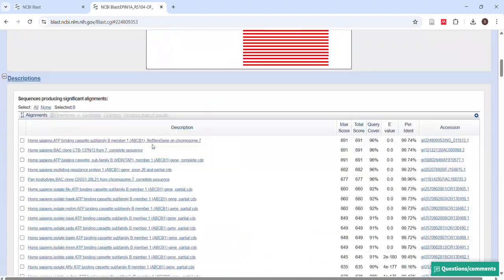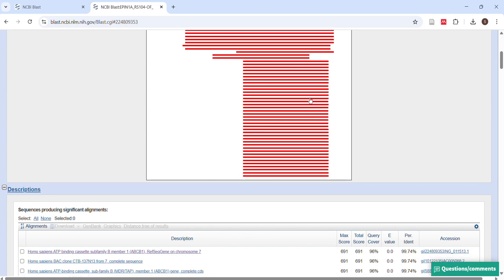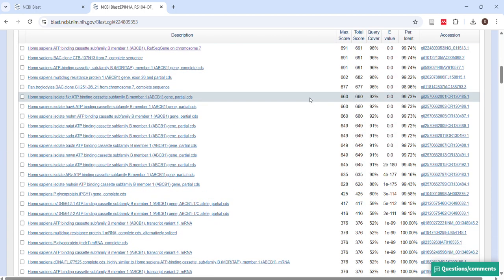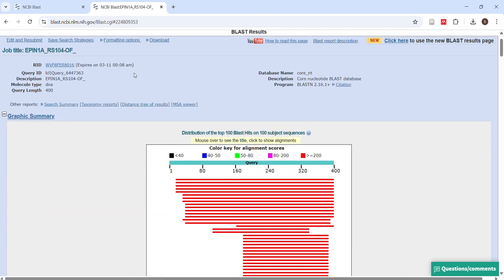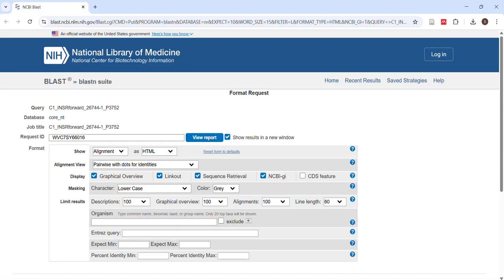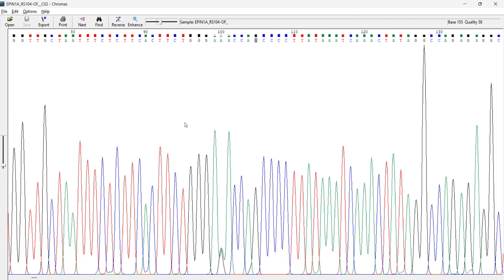And this table will show me where my sequence maximally aligns. So it shows query result 96%, so it is quite a good result. So this way I can check where all my sequence of interest is found, in which animals or maybe plants also, depending on the gene, right? So same way now we'll see, this was quite a good, what do you say, data set.